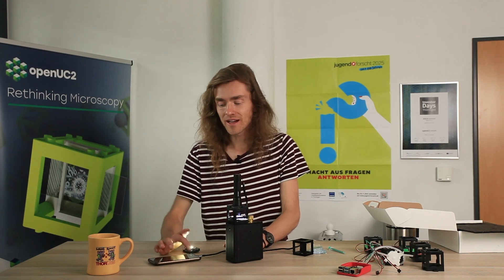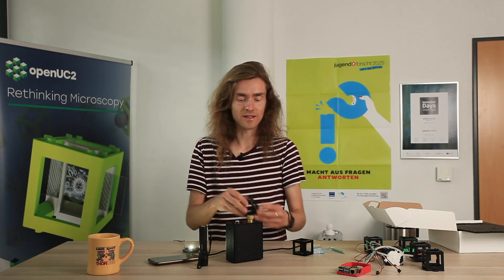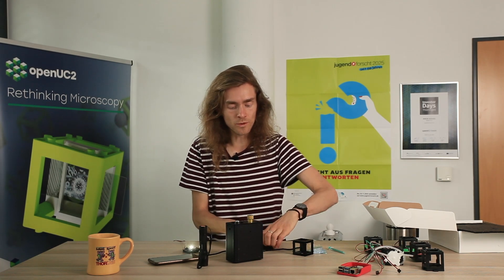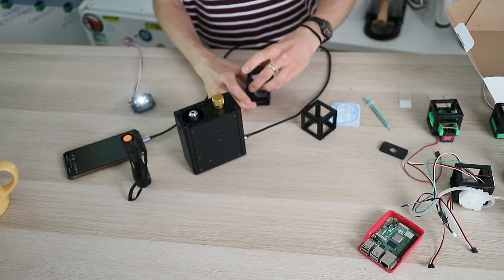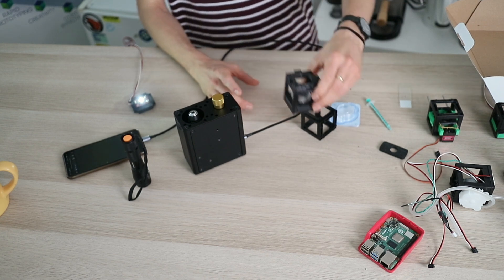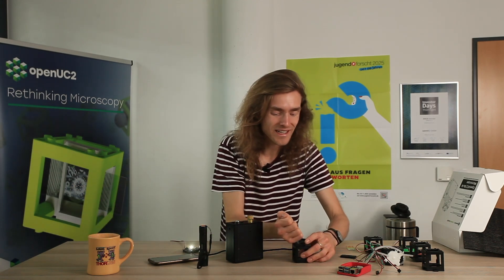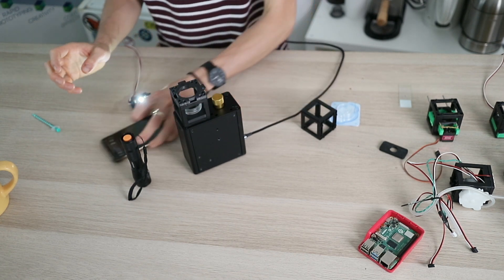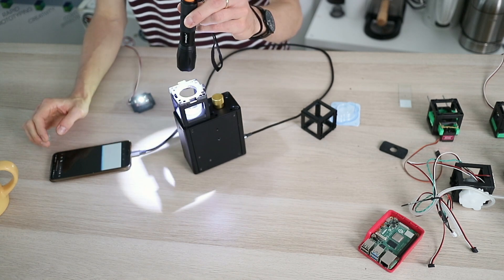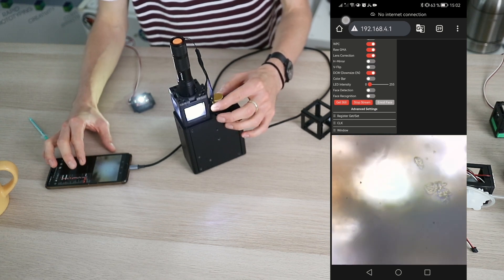Yet another thing which is pretty cool — where you can use microscopy — is when you have a sample that's not static but actually living. For this we will just exchange the cube here, remove the sample — don't cut yourself, it's glass — we open the cube here and remove the magnetic piece, and then add a little chamber that's just a petri dish. We collected some water from the pond nearby and we'll just add the water with a little syringe. You will probably never drink water again if you see what's inside. We add this to the microscope, open the stream again, and then add the torch.